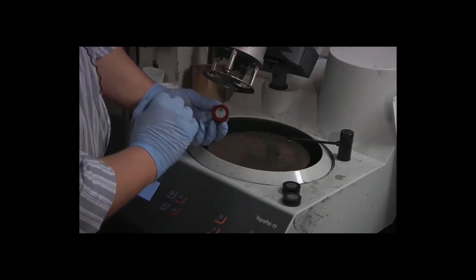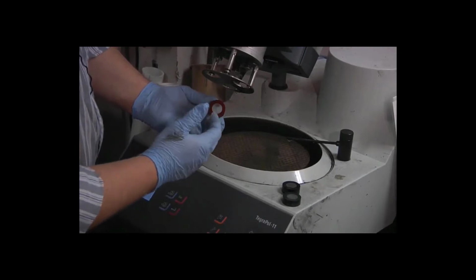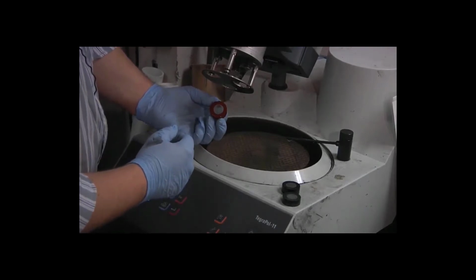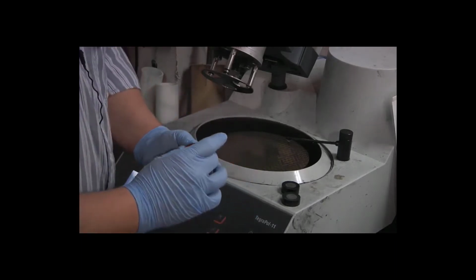And the same thing goes for the red specimen, that again we have an area where we had a divot in the surface from the cutoff process. The whole rest of the surface looks pretty good. So I think that we're okay to move forward. So I'm going to rinse these in the sink.